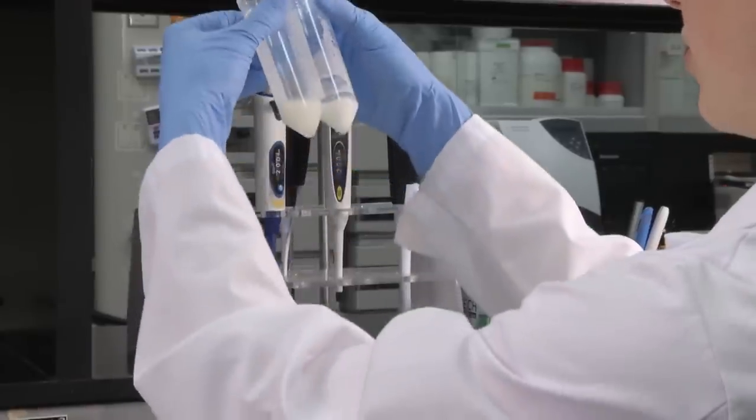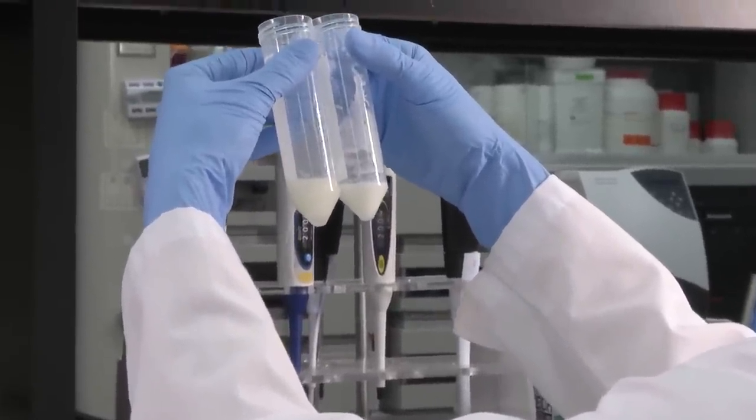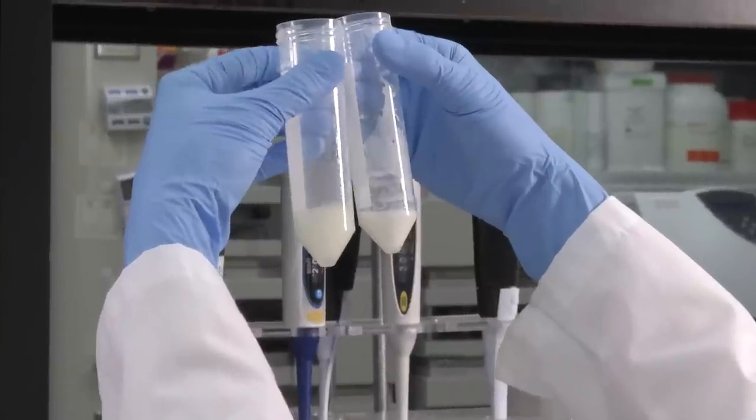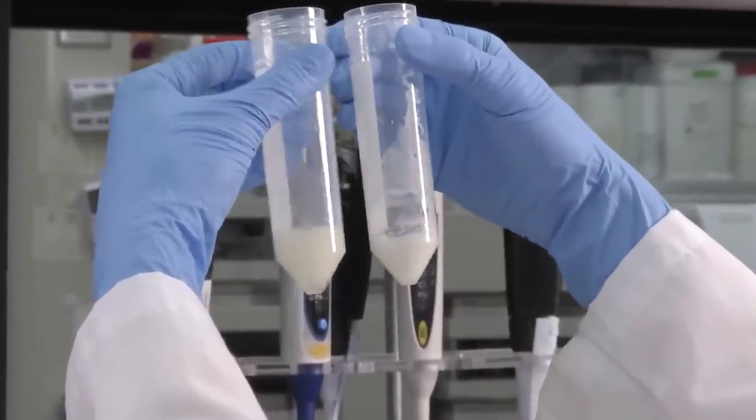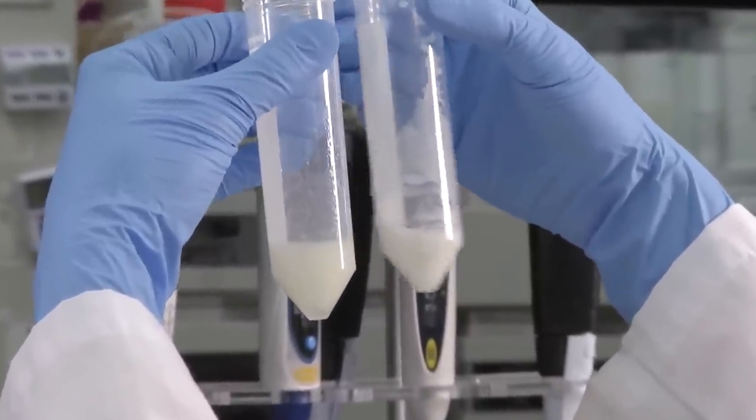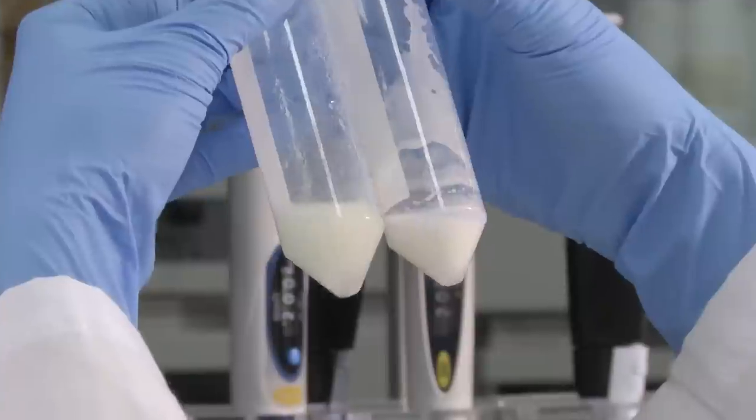You can observe visually the differences between the two emulsion types. The oil and water emulsion on the right tends to be much thicker and creamier looking than the water and oil emulsion on the left.